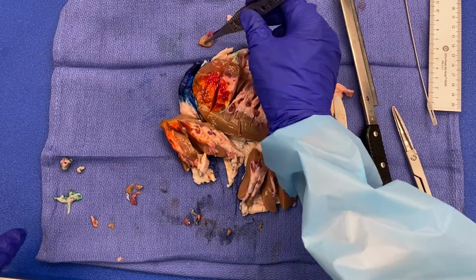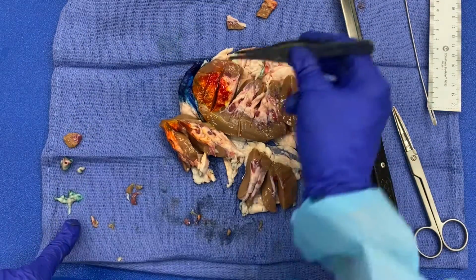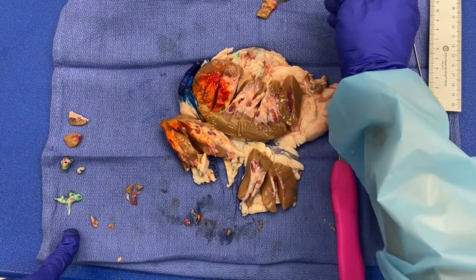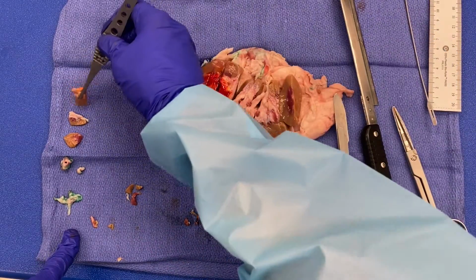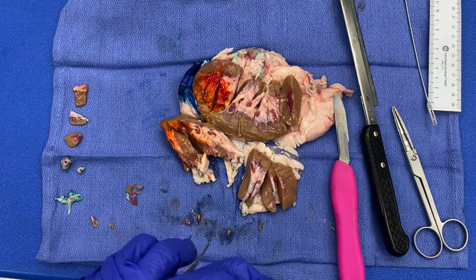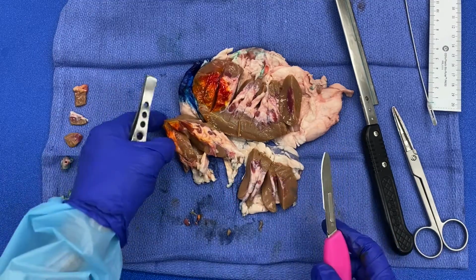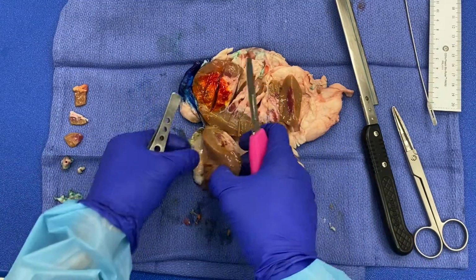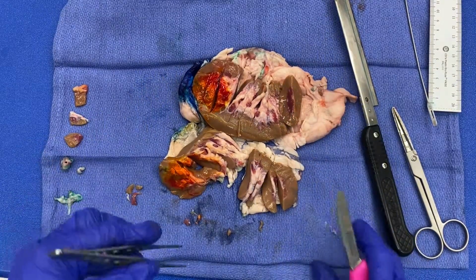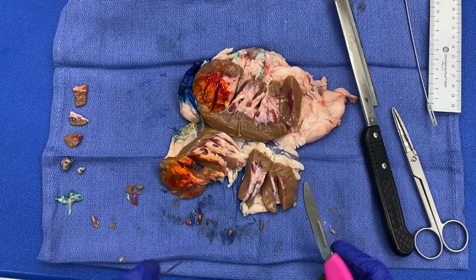I'm just moving my tissue here so you can see it. Actually, maybe I'll move it over here. We have our hilar structure margins, our uninvolved inferior pole, our uninvolved renal pelvis with renal sinus fat, our tumor in relationship to renal pelvis and renal sinus fat. And remember, you want to do 1 per centimeter of the tumor. And you want to get variegated areas, so different looking areas of the tumor.